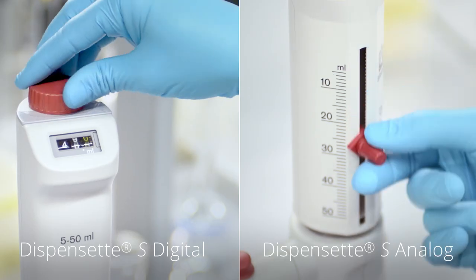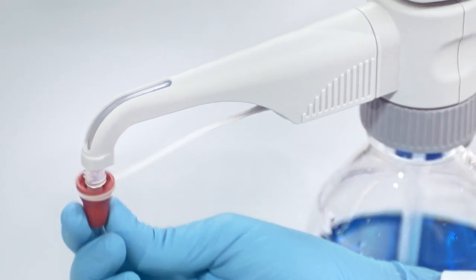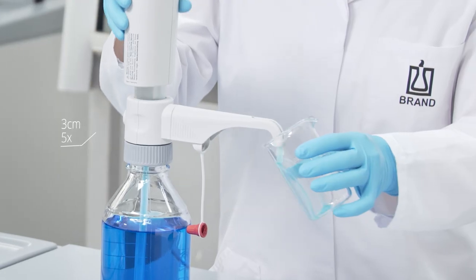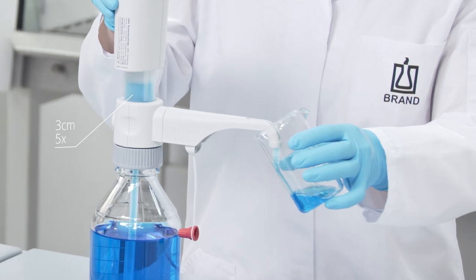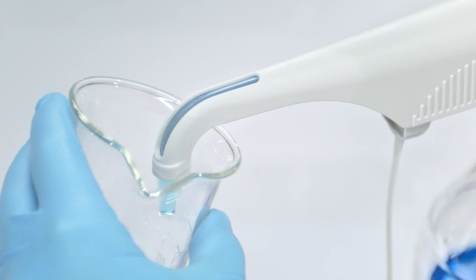Set the instrument to its maximum volume and open the screw cap of the discharge tube. For priming, pull up the piston approximately 3 cm and push it down rapidly until the lower stop. Repeat this procedure 3-5 times until the discharge tube is bubble-free. A few small bubbles do not impair accuracy.